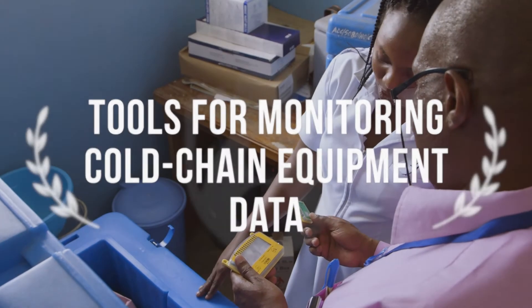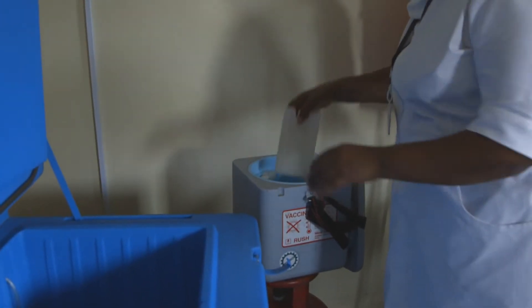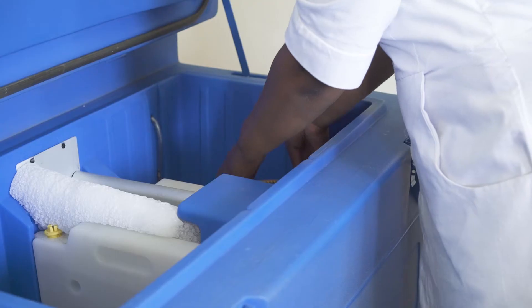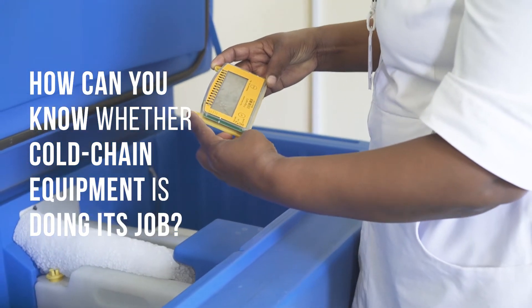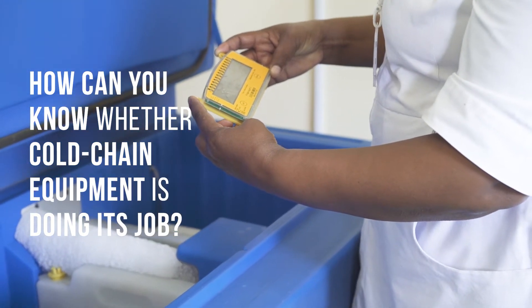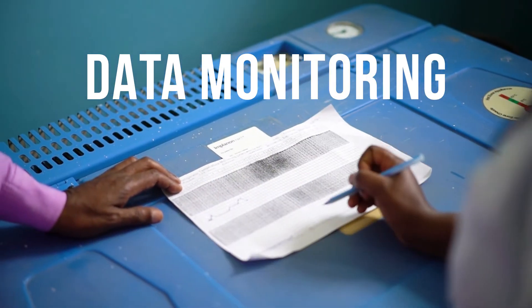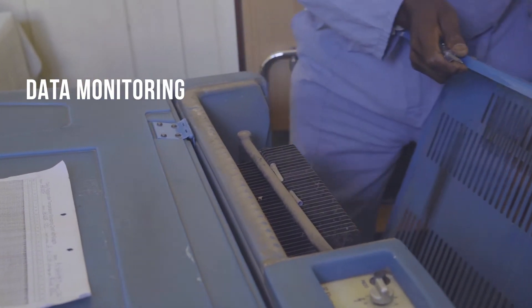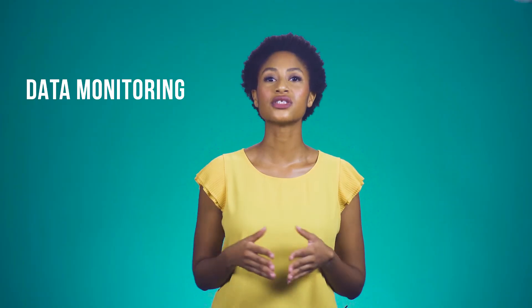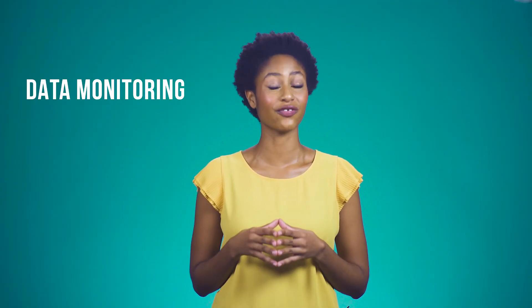Every day, you try to keep vaccines at the right temperature so they will be safe and effective for the people receiving them. But how can you know whether your cold chain equipment is doing its job as well as it should be? Data monitoring is the best way to see whether cold chain equipment is keeping vaccines at the right temperature, whether a refrigerator or freezer has had too much downtime, or whether certain cold chain equipment is creating problems for your budget and your vaccine supply.